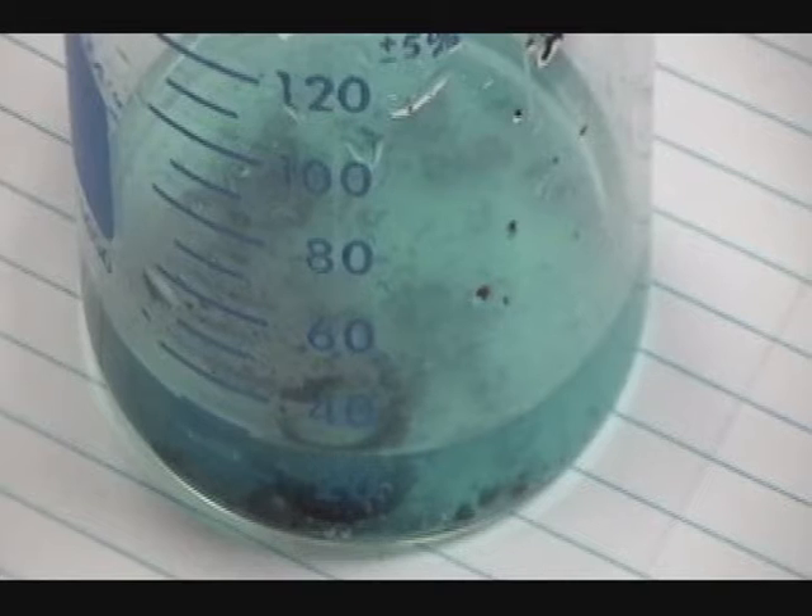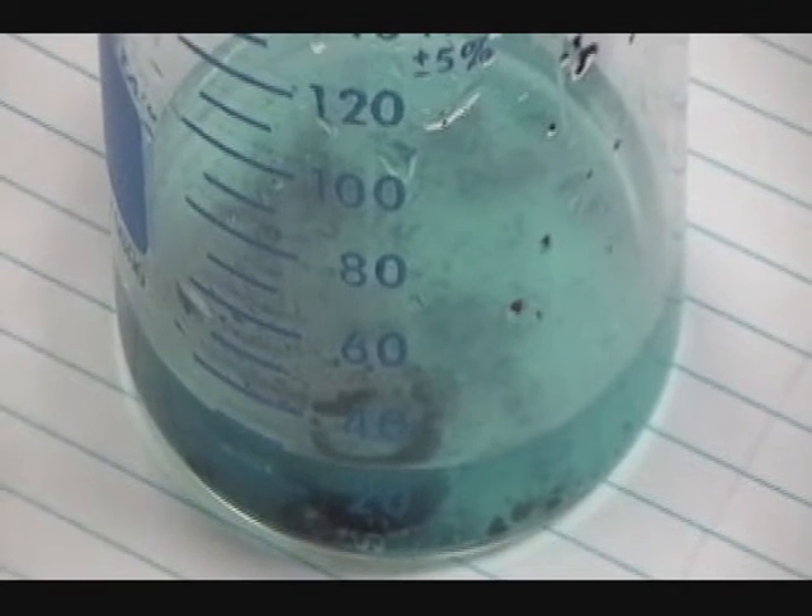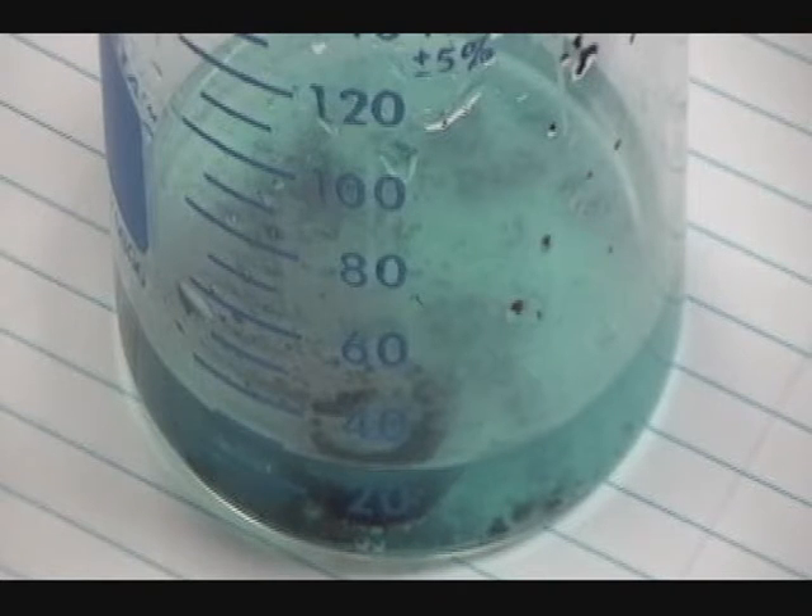The redox reaction itself will take a considerable amount of time, probably somewhere close to 30 minutes. You'll know the reaction is still going because you'll see bubbling on the aluminium wire from a side reaction which is producing hydrogen. Once you think the reaction is finished, make sure all of the aluminium has dissolved into the water. Add a small amount of acid, which should help the solvation.